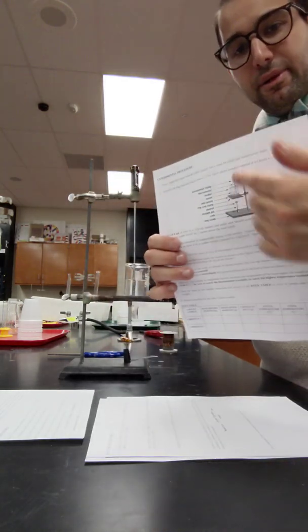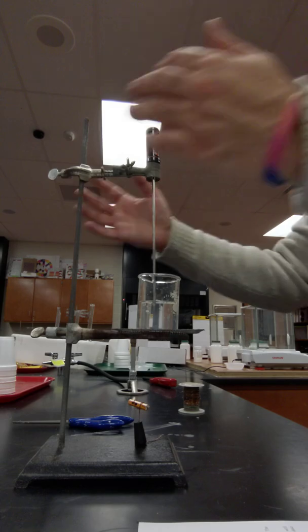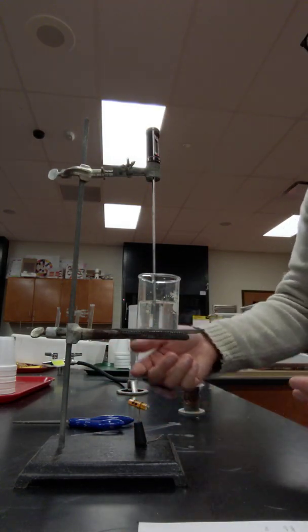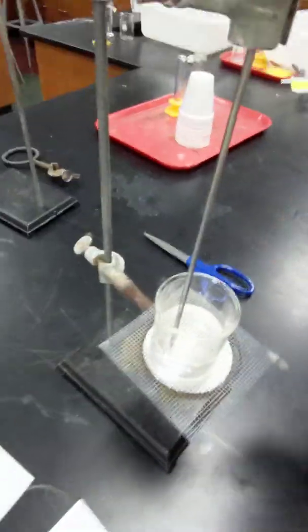Now the setup is here but I wanted to show you what it's going to look like for our lab. So you can see that I have a ring stand here and every lab bench has a ring stand. There's an O-ring, I don't know if you can see it, but there's an O-ring here that you are gonna put together and put on the ring stand. Right here's the O-ring. You're gonna put it on the stand.